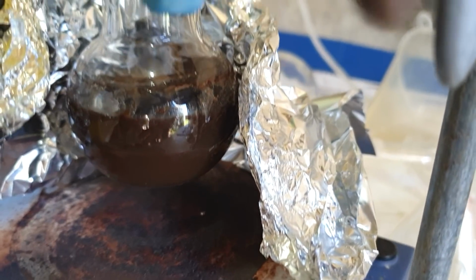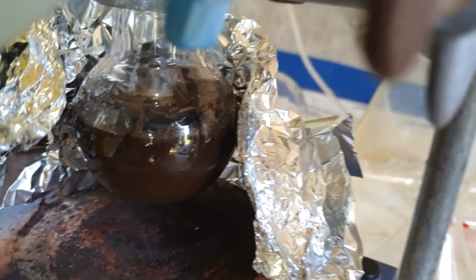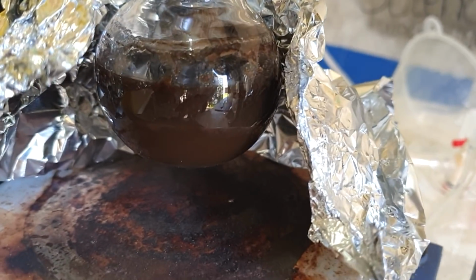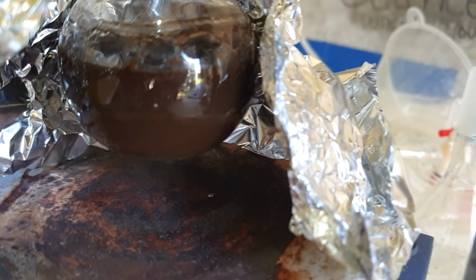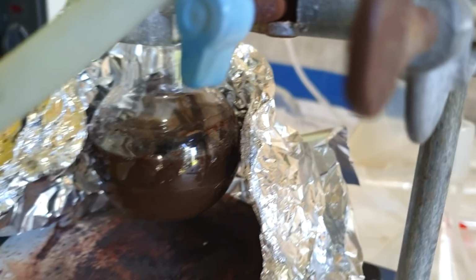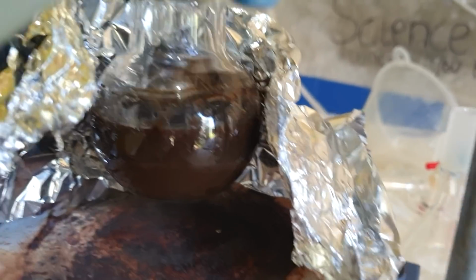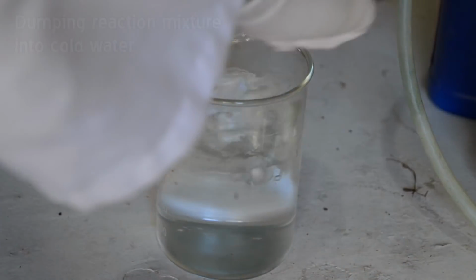What we're going to do is dump it out in a whole lot of cold water, like 500 mils or so. So it's quite a lot of stuff, and that'll dissolve the bromide, but precipitate out our products, and then we can filter that off. At the moment, the precipitate is the thing that we don't want. Everything that we want is dissolved, so we'll be swapping that around by just dumping it out in a whole lot of water. It's not a great colour, but we'll see how we go. It never is the bloody right colour.